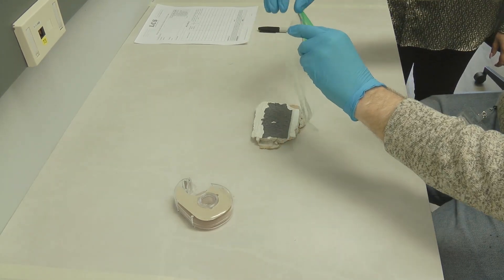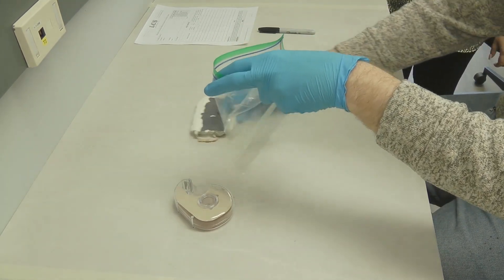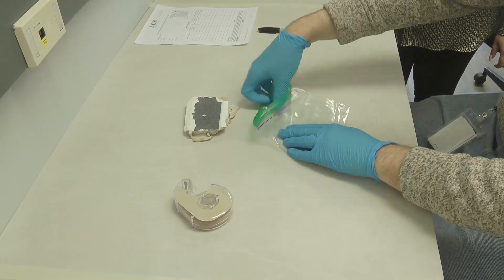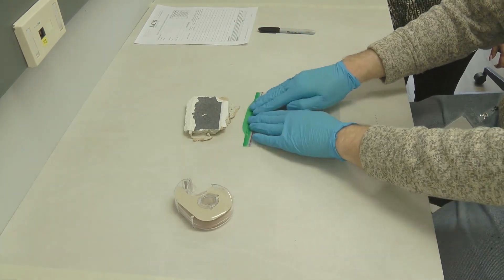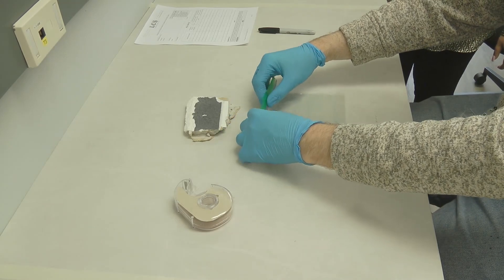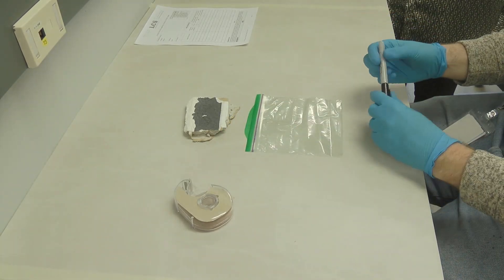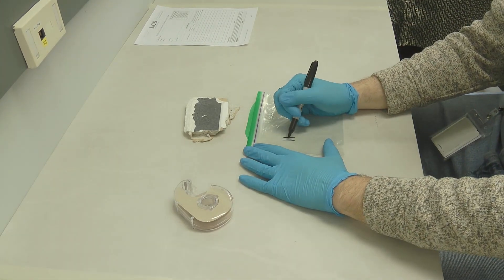And that's it — you've collected the imprint of mold spores on the sticky tape. Get a clean ziplock bag and gently press the tape with the mold sample against the inner surface of the bag. The mold spores are now sandwiched between the tape and the plastic bag and are ready for lab examination.